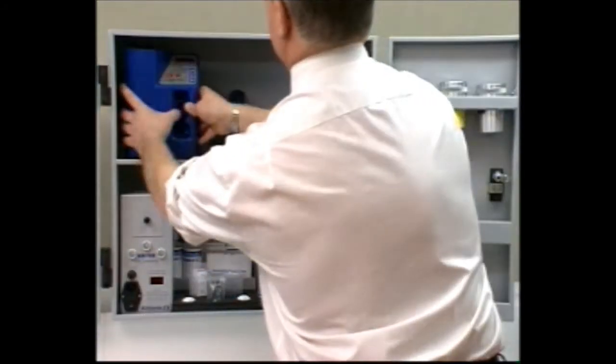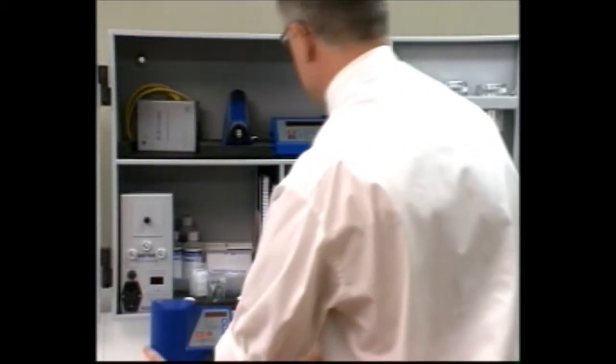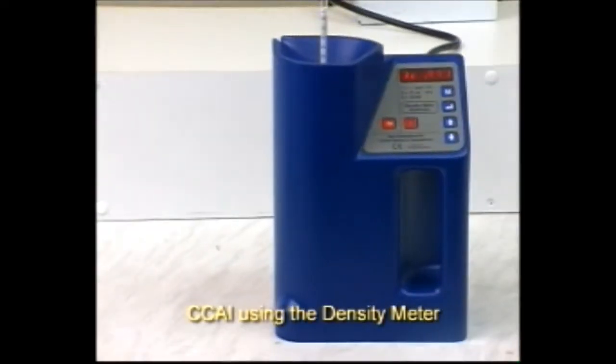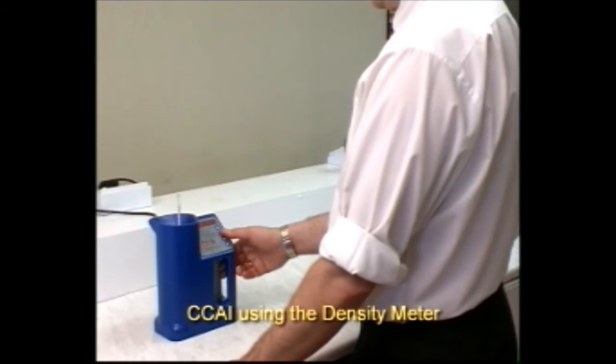This section shows you how to obtain the CCAI from density corrected to 15 degrees Celsius in vacuo.